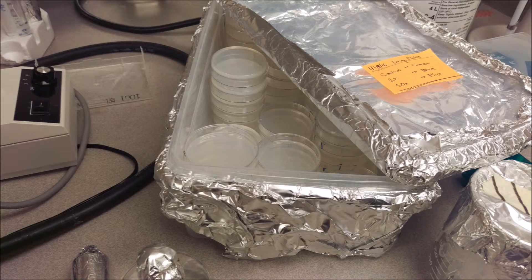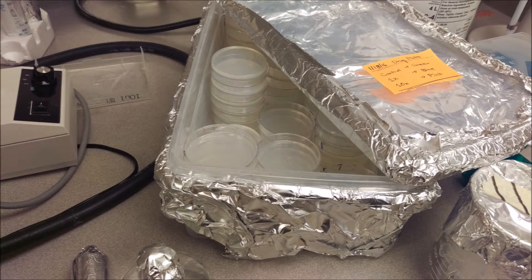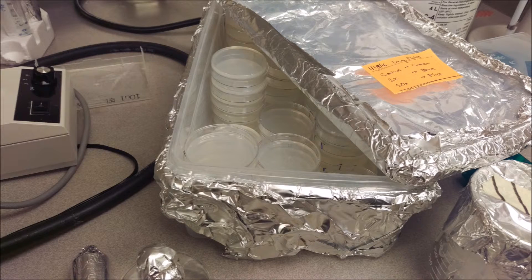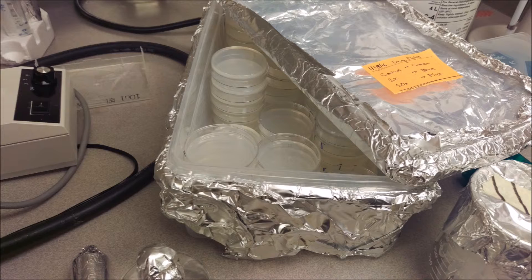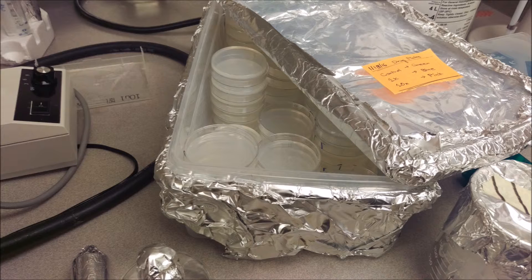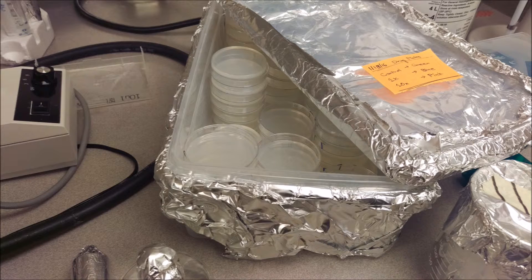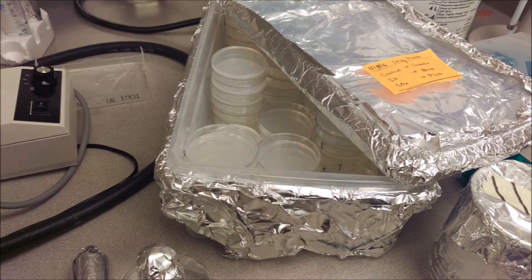My experimental setup was quite simple. With the help of my mentor, Josh Russell, we added TA65 to all of our worm plates, then proceeded to seed each plate with 30 to 50 worms. To increase the likelihood of good data, we used three different concentrations of TA65.